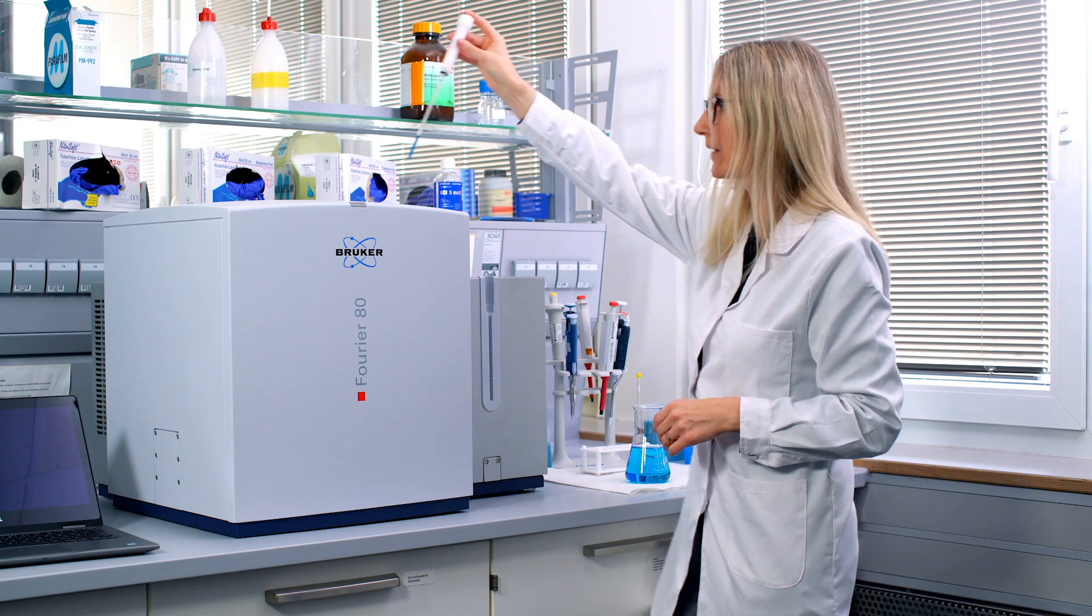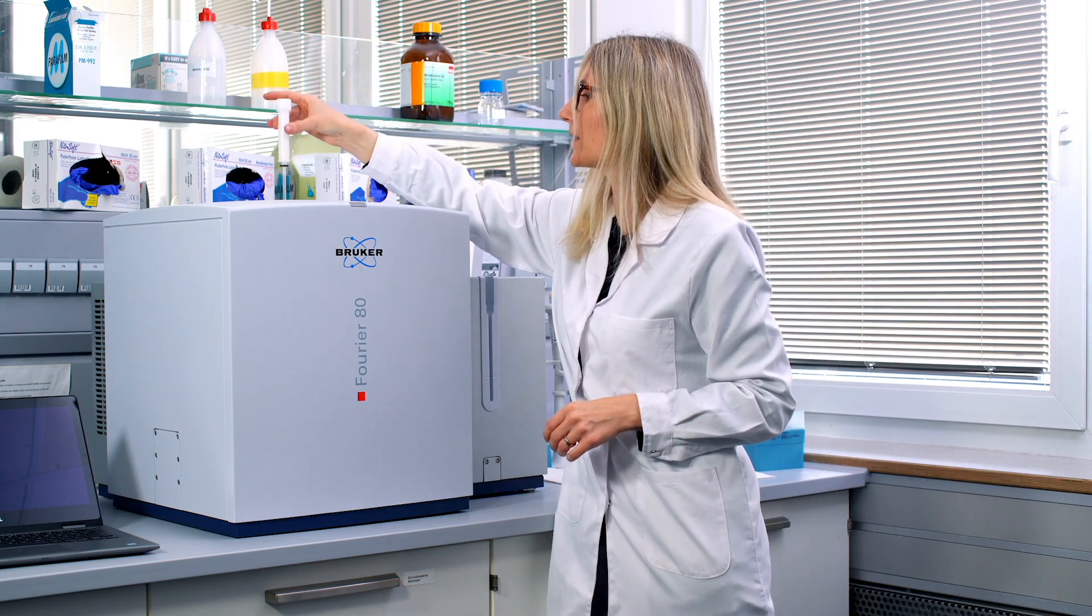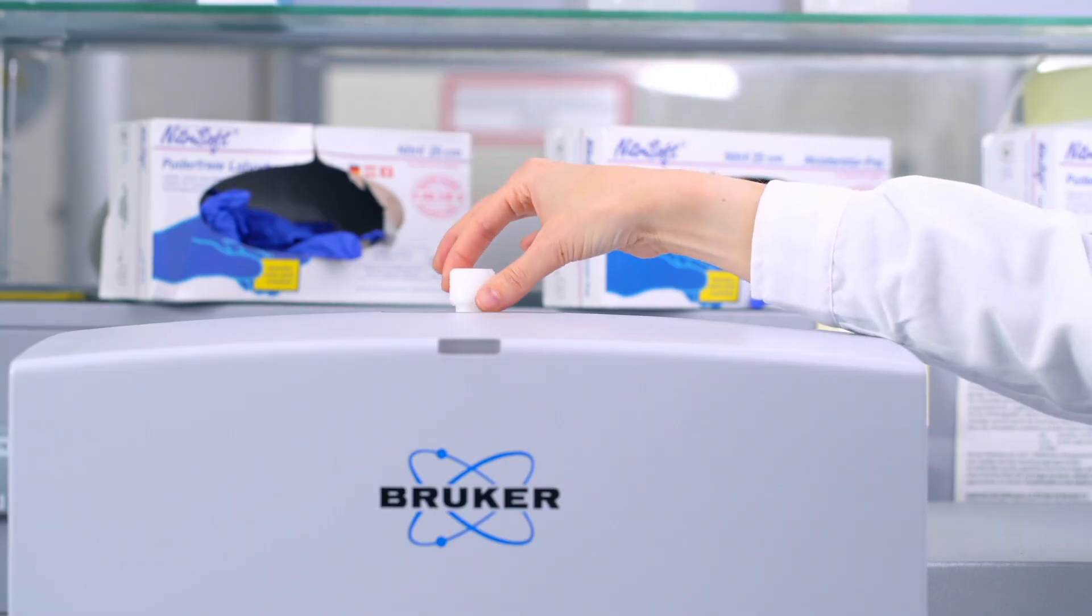So we're taking it out straight and we are just inserting it from the top. And basically that's all you need to do.